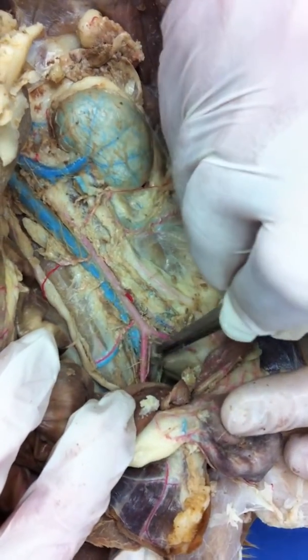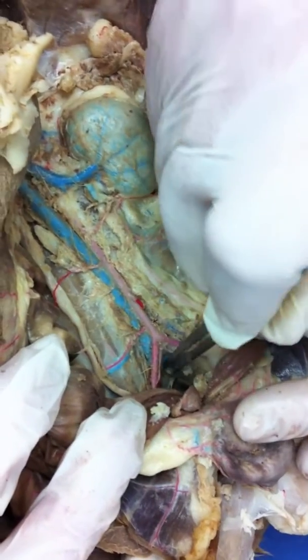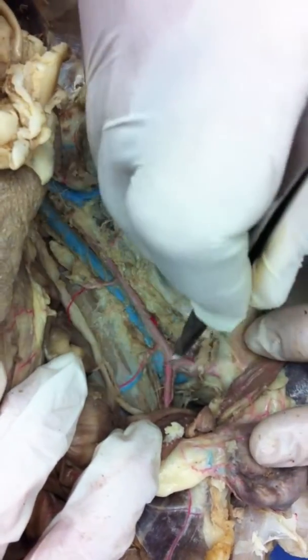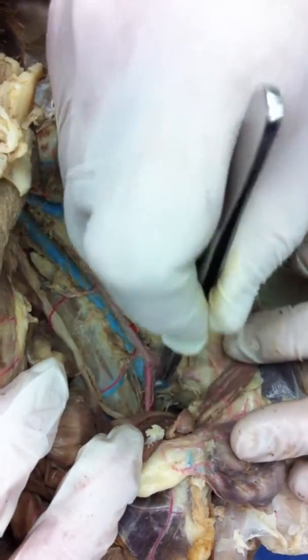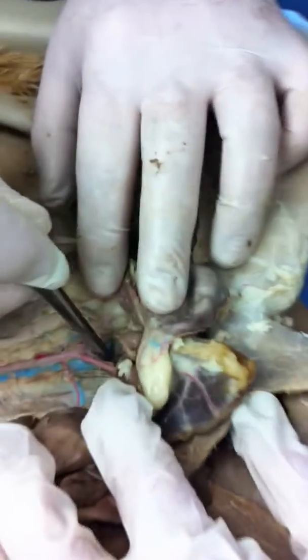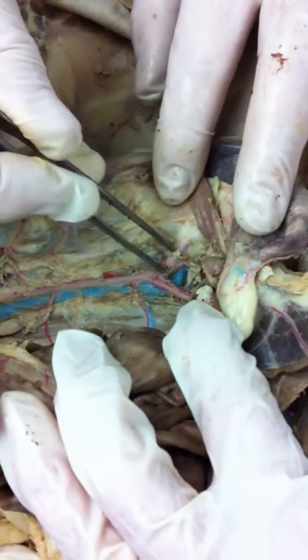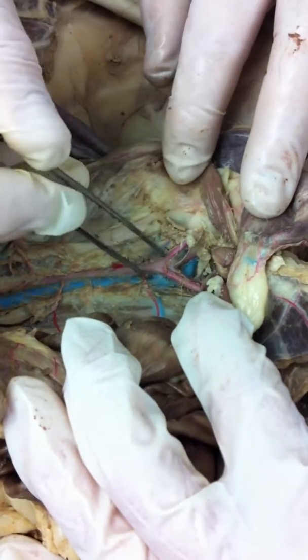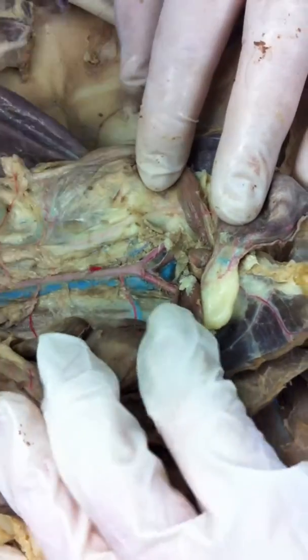Now, if we keep working this just a little bit, do we need to say right external iliac? Sure. And then right internal? Yeah. Only if you don't want to miss it on the test. And don't. We may come back and look later on for a sacral or a tail.